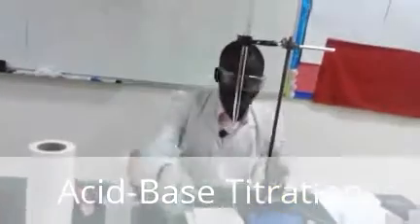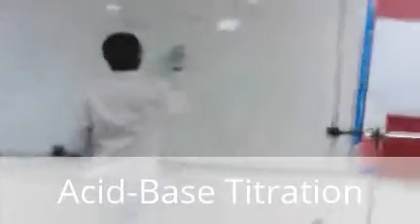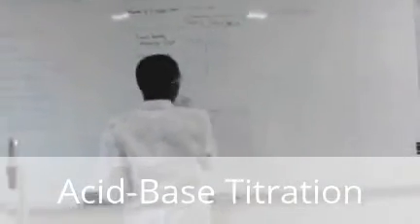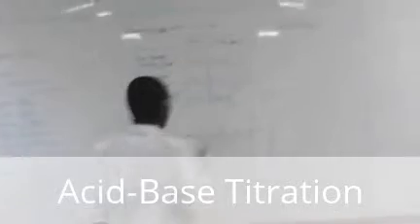This is now a colorless solution. I record my volume. Still it is 28.5. So my initial was 0.0, final 28.50. So the volume of hydrochloric acid which has been used to neutralize the base is 28.50.